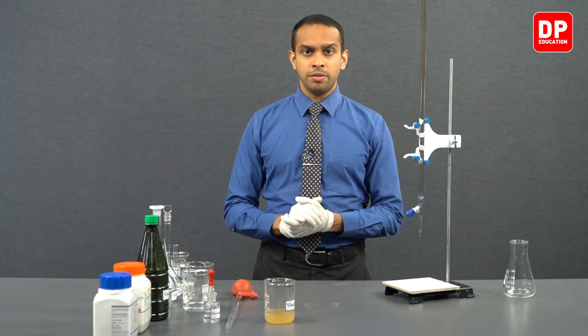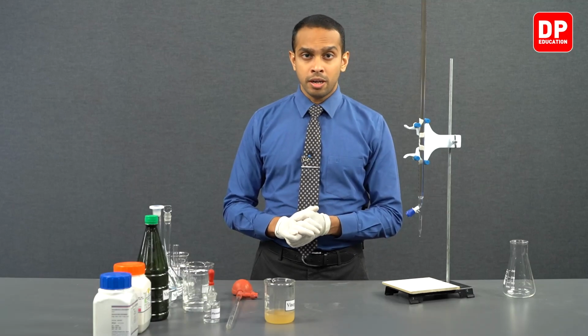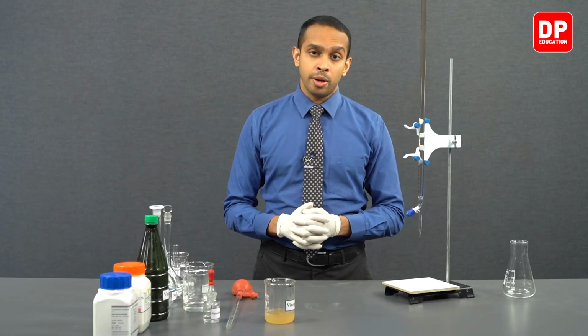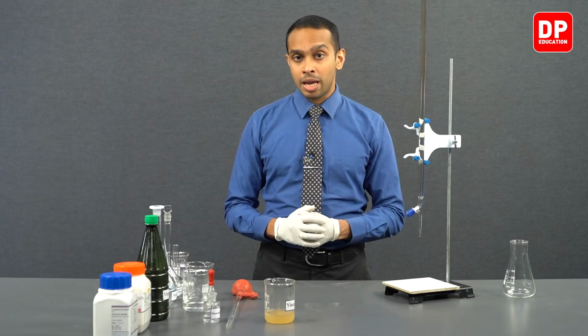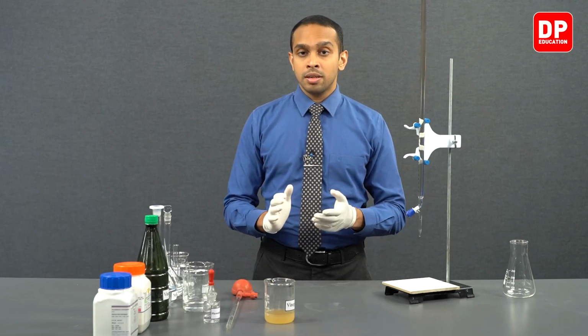Students, we have observed the first and second titrations, and we have gotten readings that are concordant with one another. First titration reading was 21.4, and then the second titration reading was 21.3 cubic centimeters. Both of these values are within the difference of 0.2 of a cubic centimeter. So therefore, these values are concordant. All that is left for us to do is our third titration. We'll follow the same exact steps that we followed for the first and the second titration and complete this set of titrations.